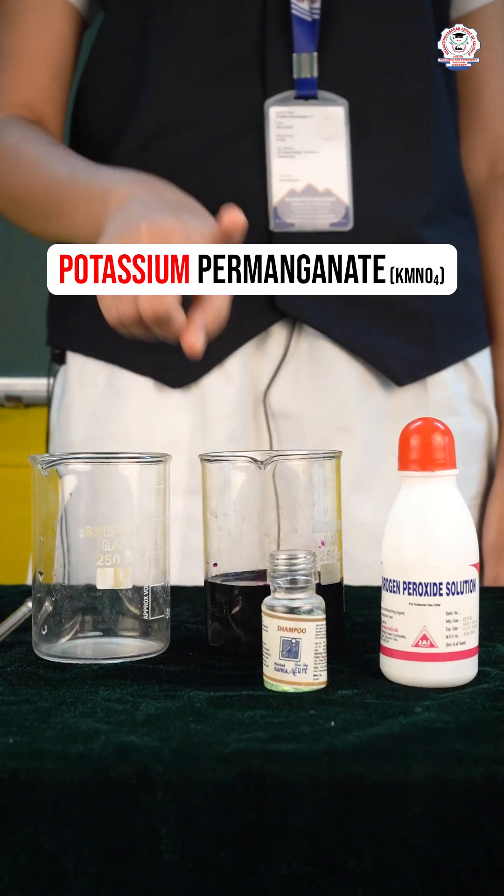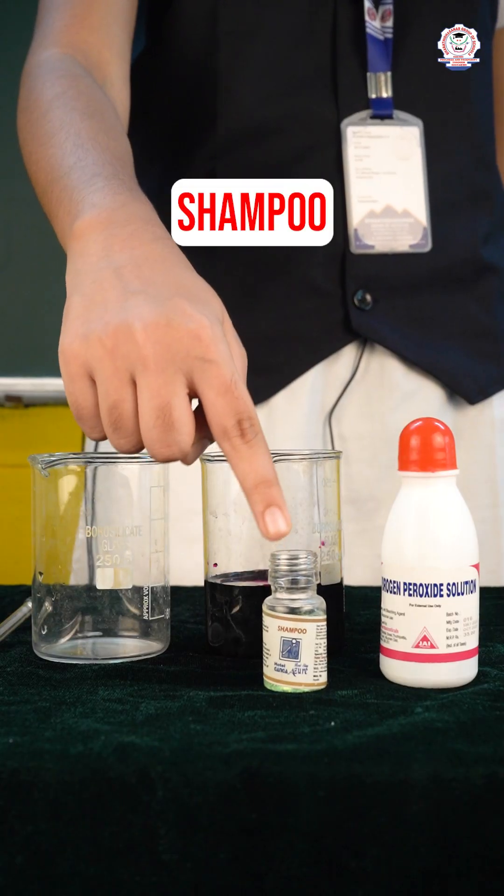This is hydrogen peroxide. This is potassium permanganate and I use shampoo as foaming agent.